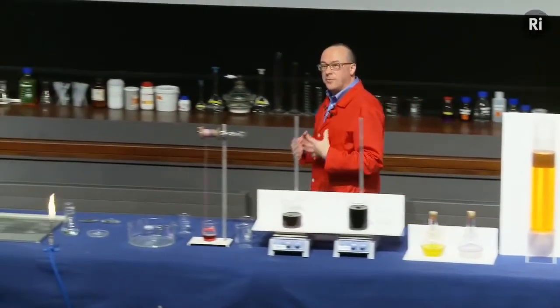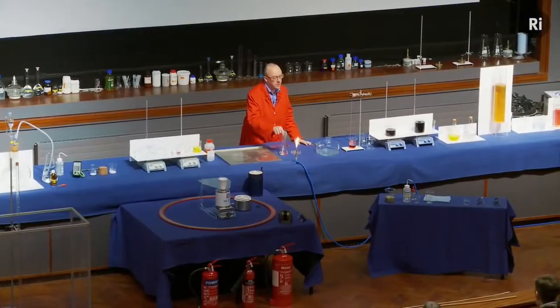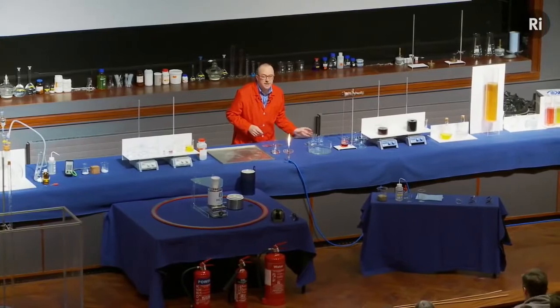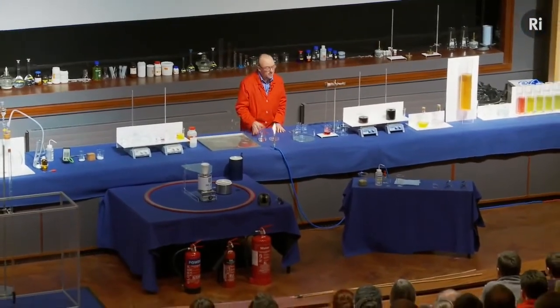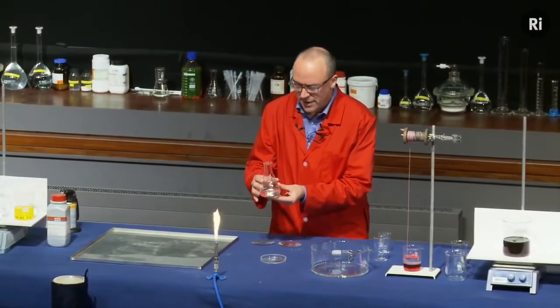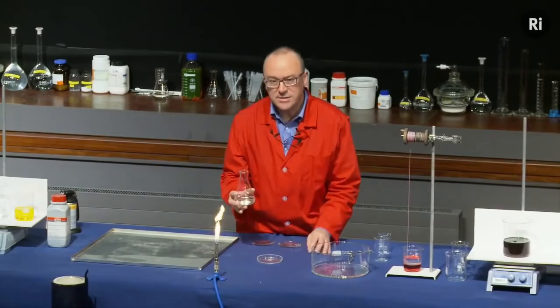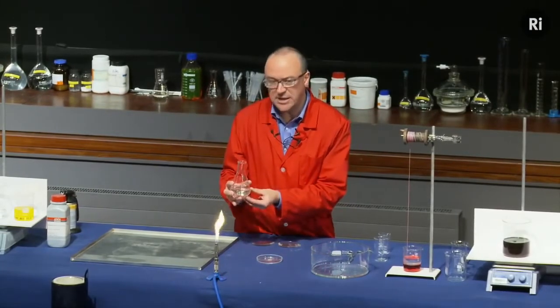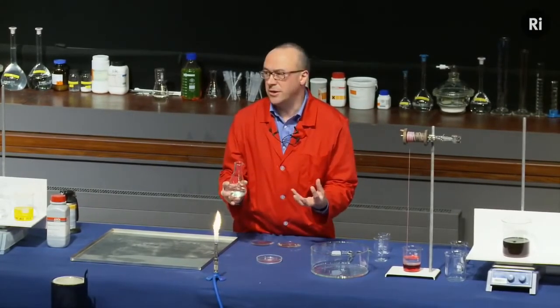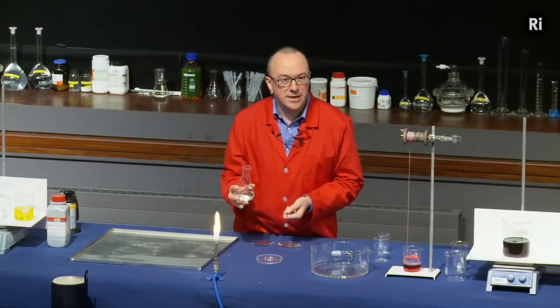Okay, so that's an example of a chemical reaction that produces a change of state. I want to show you another example of a chemical reaction. Again, this is going to go from being a liquid to being a solid. So in this flask, I have a solution of sodium acetate. And this sodium acetate's a liquid, as you can see, but it would very much like to be a solid. It would like to turn into a crystal. But it needs a sort of an excuse to get going.